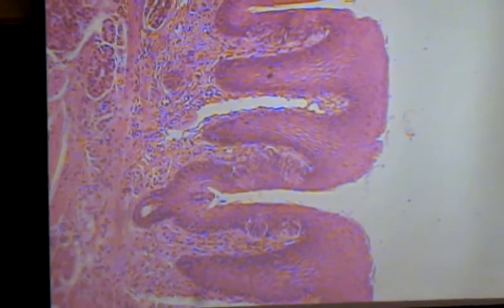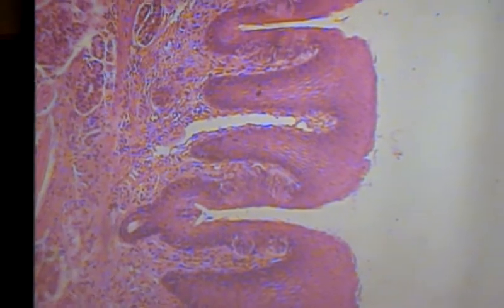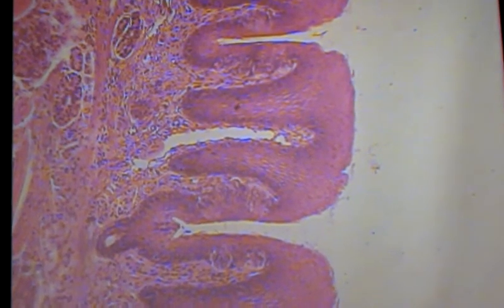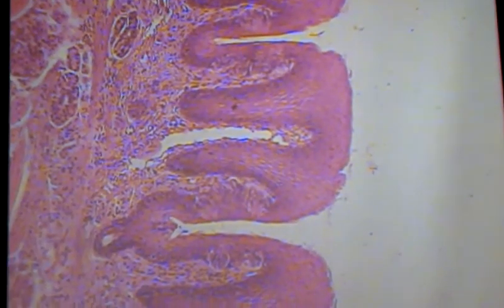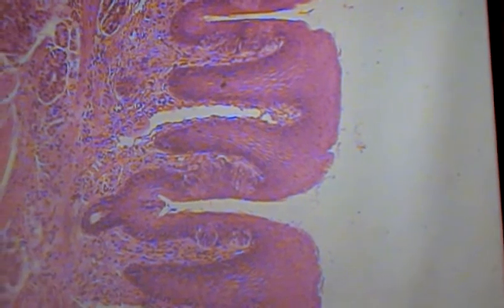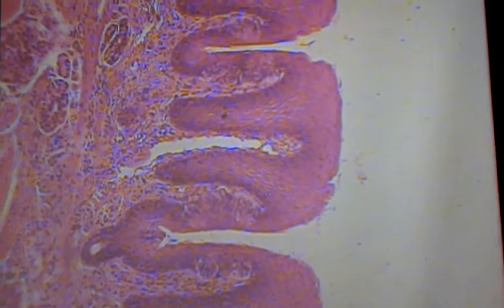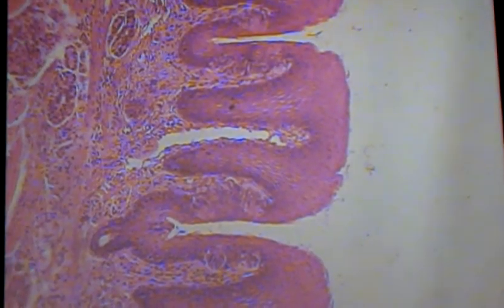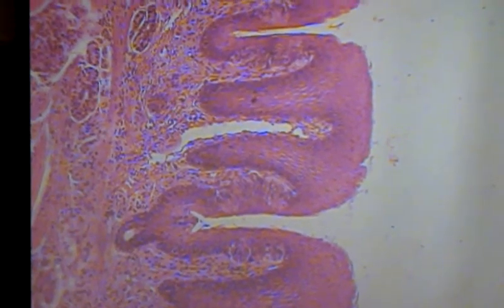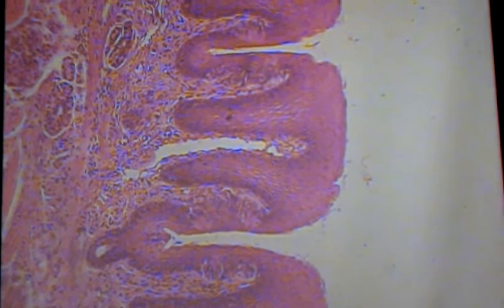Now, because this is a free surface at the tongue, we have an epithelium. The epithelium is a stratified squamous epithelium. Now, depending on the book or the histology atlas that you reference, and depending on the type of papilla, there's 4 different kinds of papilla, sometimes the epithelium is non-keratinized, sometimes it's keratinized, sometimes it's intermediate between the two, and they call that para-keratinized. We're not going to deal with any of that. All we're going to concern ourselves with is that it's stratified squamous. Don't worry about saying keratinized, non-keratinized, or para-keratinized. We're not interested in that.